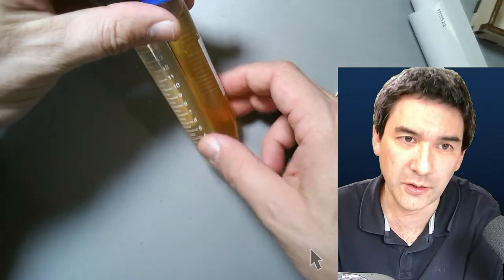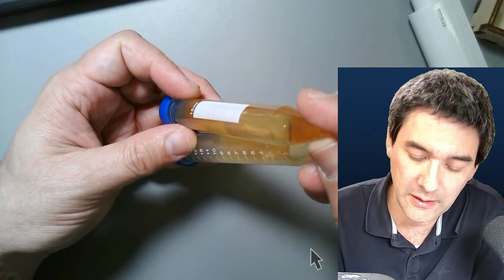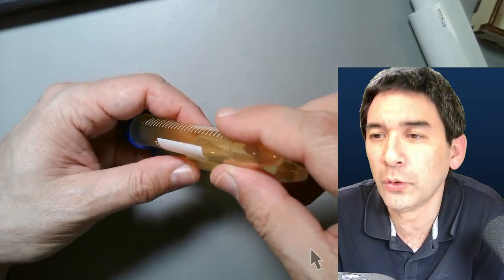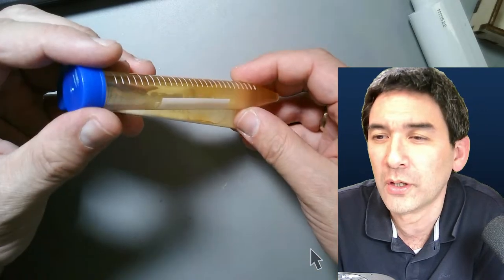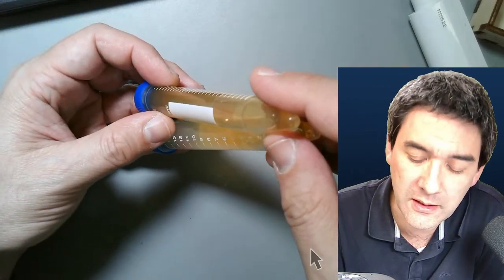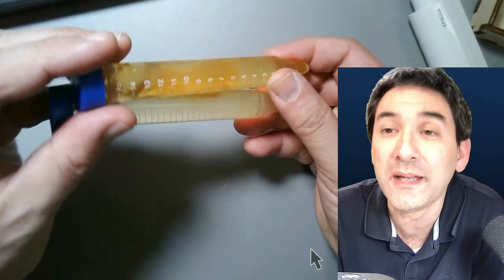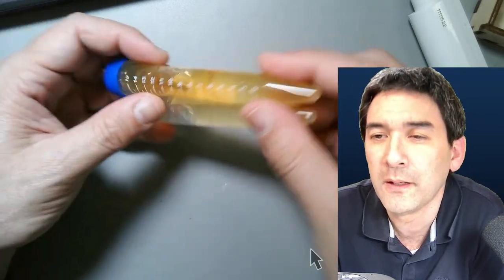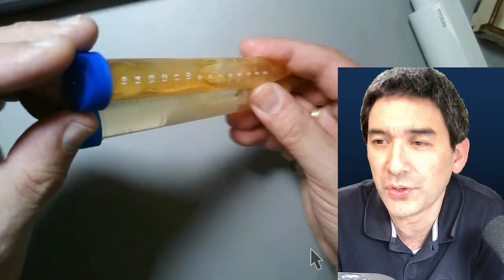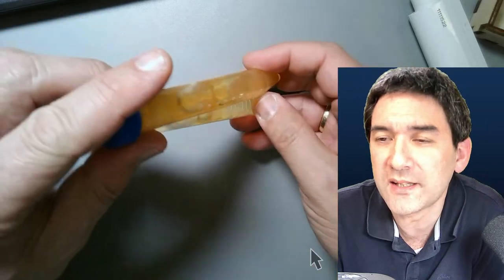Water dilution lowers viscosity and centrifugation concentrates the solid — that's basically the approach. If I do not dilute it, the pollen are going to stay suspended and I'm not able to concentrate them. You can use glycerin jelly to stain pollen during the mounting process, and glycerin jelly contains basic fuchsin as a stain. I might try methylene blue as well.